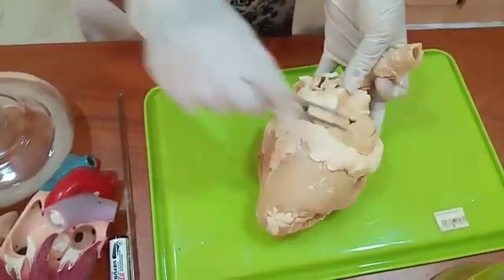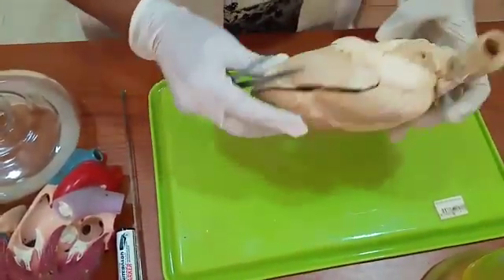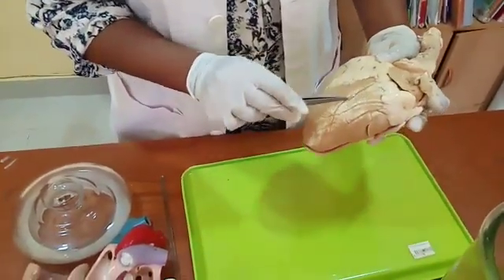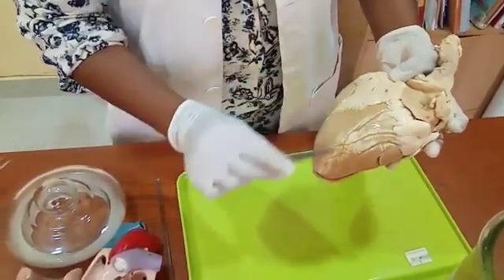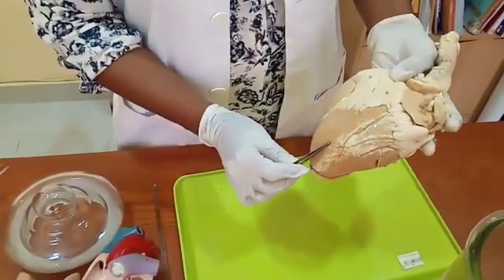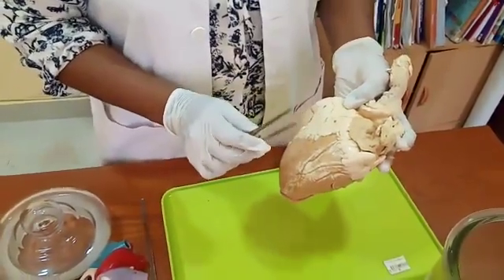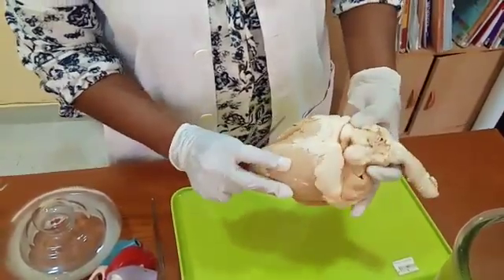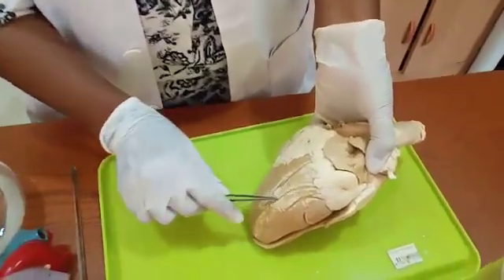These white color things are the fat — extra fat deposited in the heart. Also, one more thing I want to show you: these are arteries and veins — special arteries and veins which bring blood to the heart. We call these coronary arteries and veins. You can see the coronary arteries and veins clearly, which bring blood to the heart.